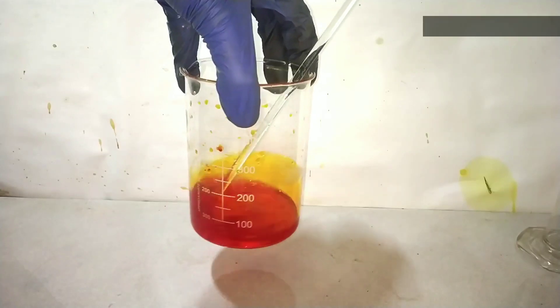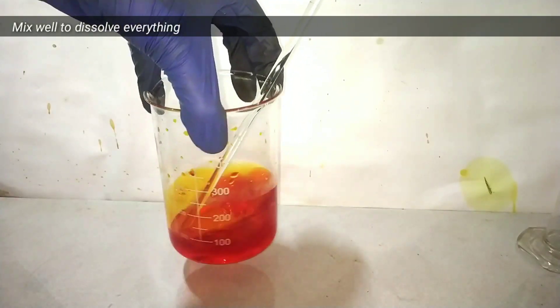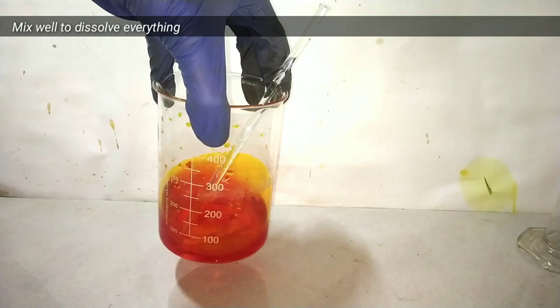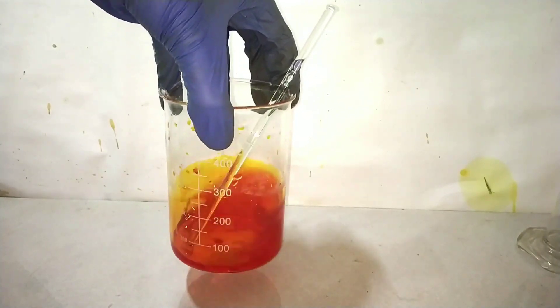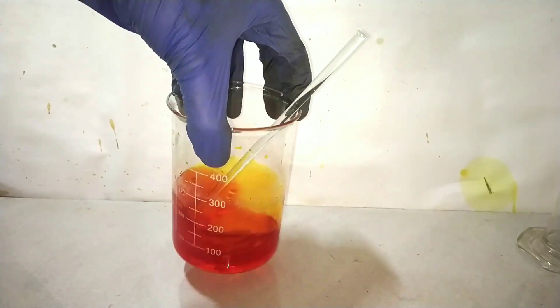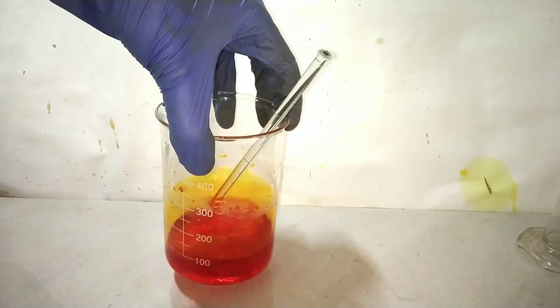After adding the acid, give a good stirring and swirling to dissolve everything up. We can also apply gentle heating if something remains undissolved, and if it still remains undissolved even after heating, you can filter the solution.